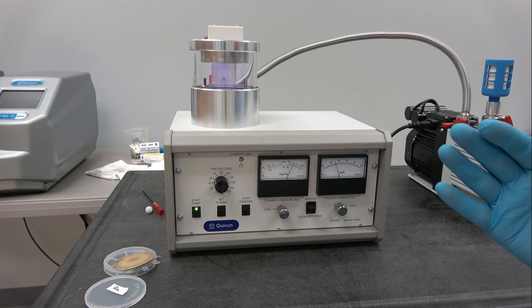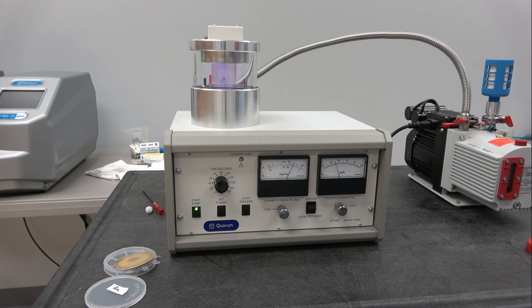With the more advanced Q series coaters, this process is computer controlled, thus highly accurate.